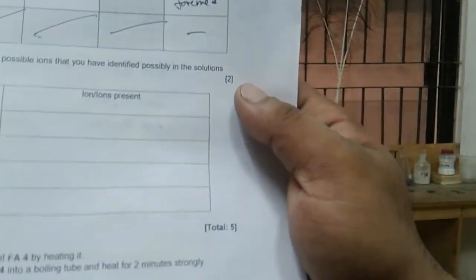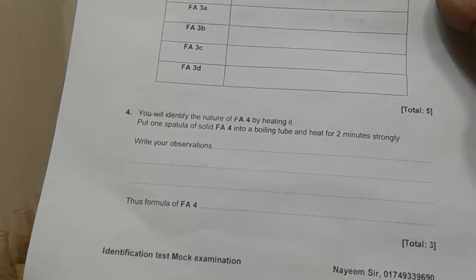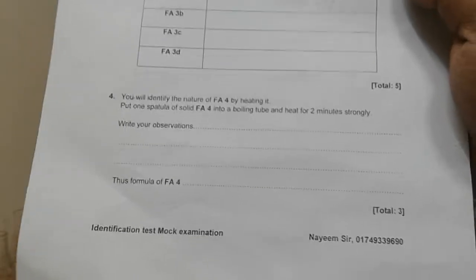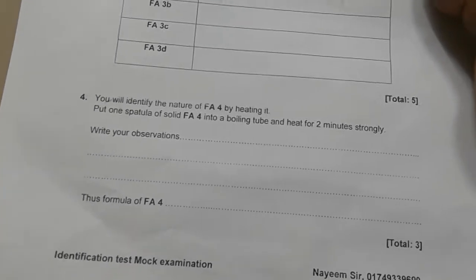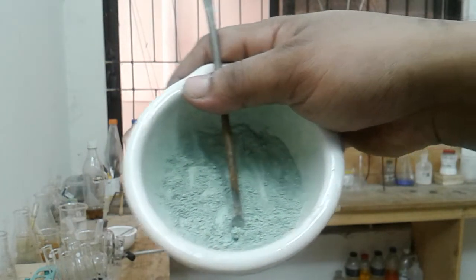Okay, so our observations will be gas evolved. We will not do the gas test, but we will write it. So gas evolved that turns lime water milky, and a black solid remains. Black solid means copper oxide, isn't it? And the gas that was coming out, since it didn't have any color, must be carbon dioxide because we have obtained the gas after heating a solid. All right. So the formula must be copper carbonate, and just remember the color of copper carbonate. It is green. It's light green.